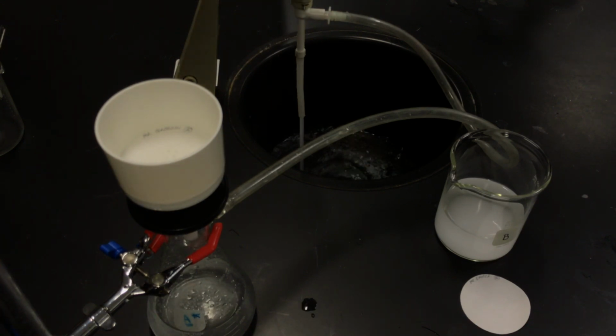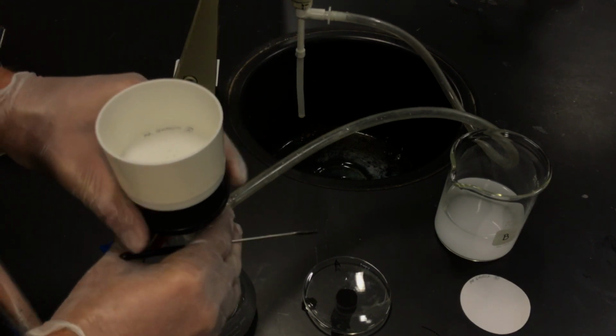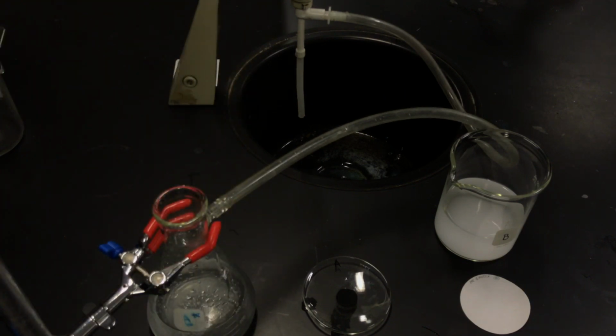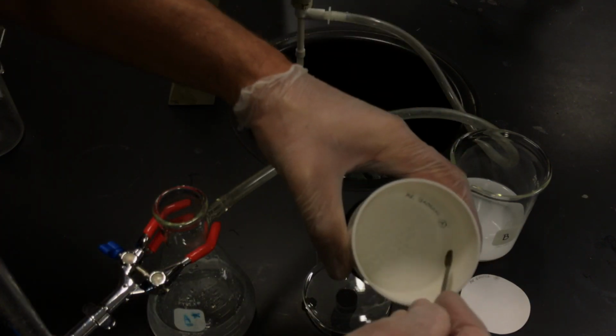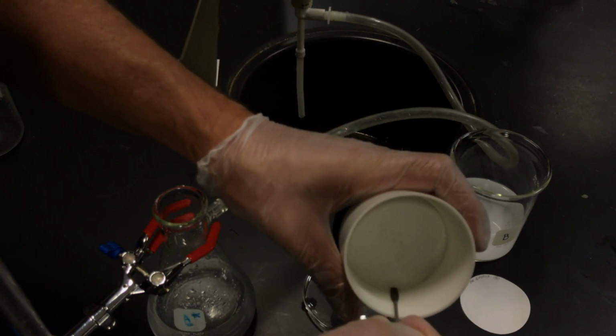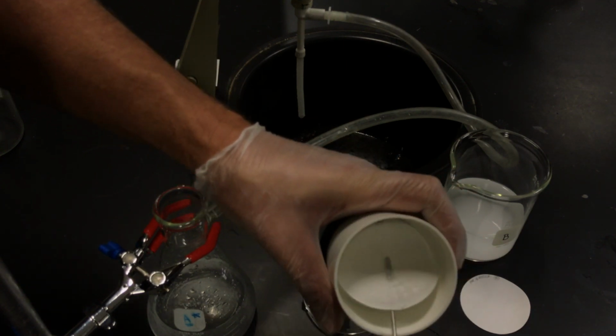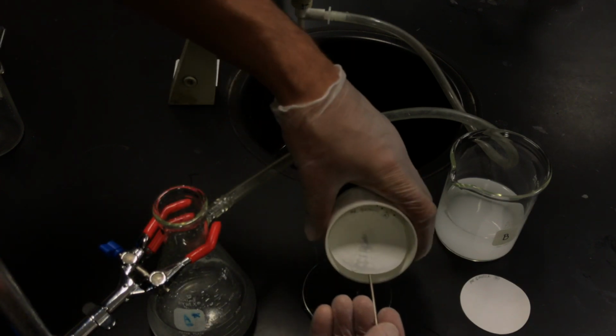So my next step is I'm going to take my watch glass, and I'm going to get this filter paper out. I'm going to conserve some water here, and I'm going to take what we call a spatula, and we're going to remove the filter paper, kind of like removing an omelet here. So carefully take this off, and all I'm going to do is kind of scrape around the edge to get a corner up and try to get underneath it, and try not to lose any of my precipitates.